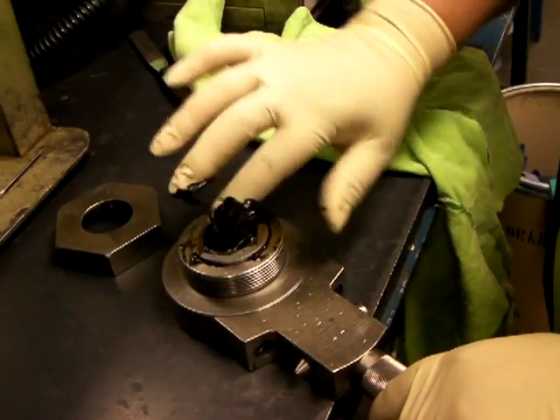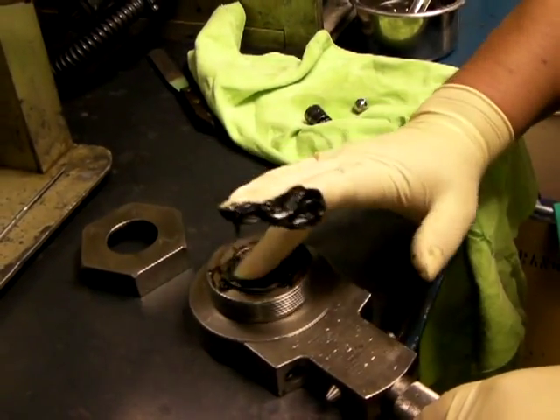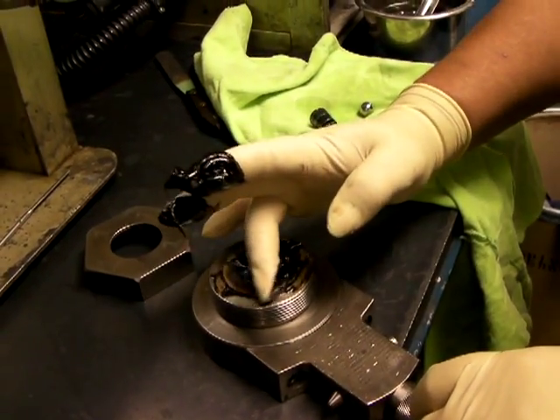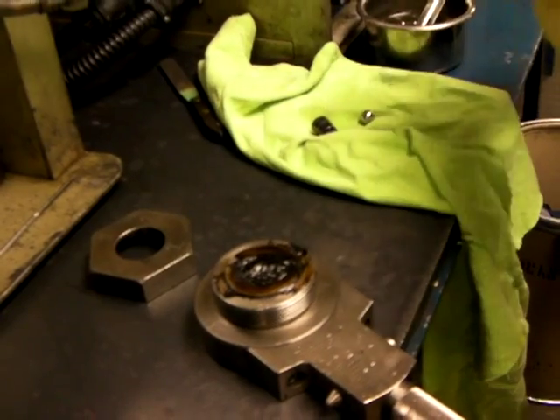Does it have to be exactly the same amount of grease every time, Carmen? You try to have the same amount in the cup to make sure all your balls are down, covered, and together. You don't want them offline. But it doesn't matter if it's off a gram or two either way — as long as they're covered.